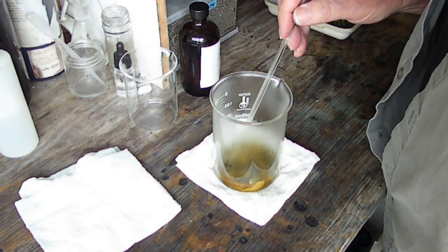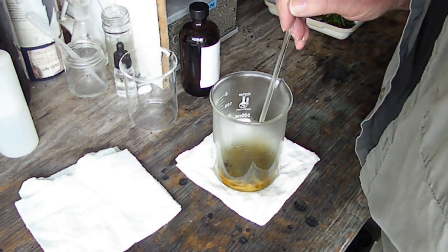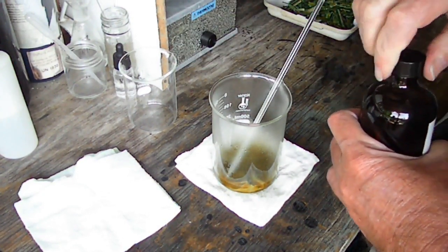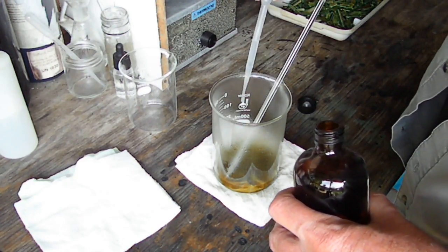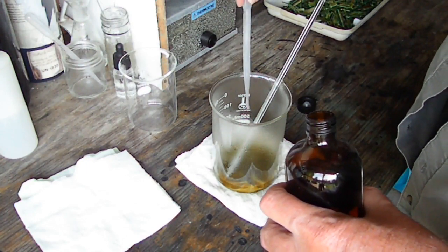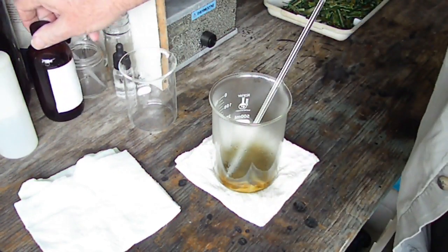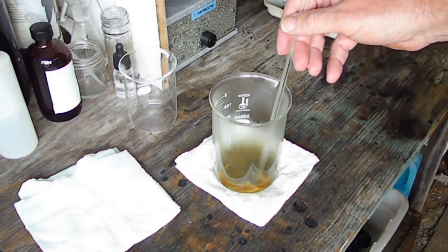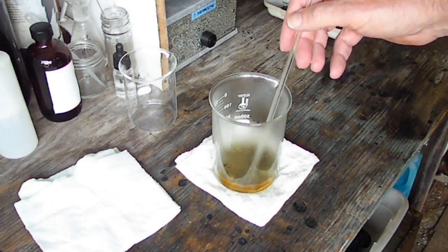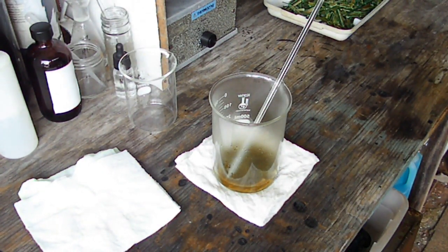Okay guys, it's been about an hour. I see a little tiny bit of reaction still going — very, very fine. I also see some tiny specks of gold. Just for grins and giggles, I'm going to put a couple more drops of nitric in this and leave it sit. We didn't have to put it on the heat. I'd rather be safe than sorry — I don't want the lack of a drop or two of nitric to cost us triple that in gold. I'll come back out in about another hour and check it, then we'll filter it off, do our drop, get our other button, melt them together, and see what we got.